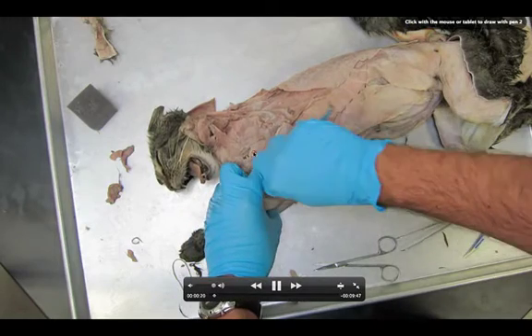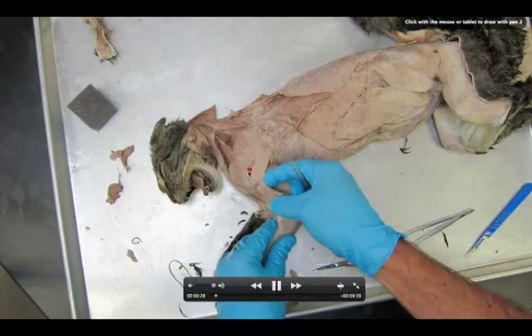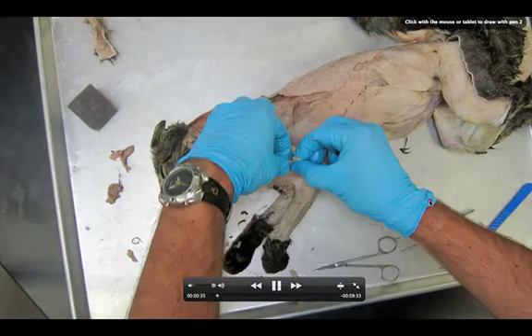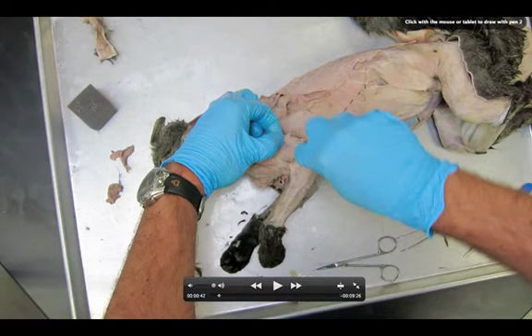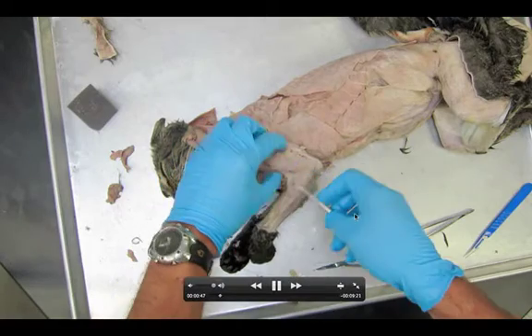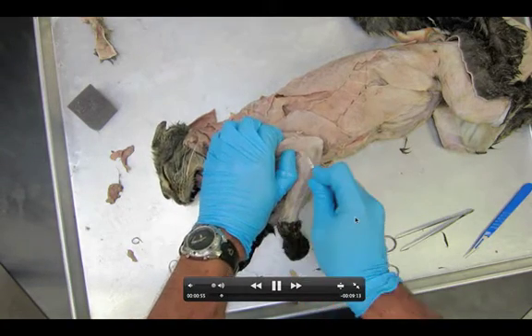It's going to be a lot of connective tissue. In fact, if you got that connective tissue off for the spinodeltoid, that same layer is going to come down as you got that spinodeltoid and acromiodeltoid. Continually pull off that white stuff to get yourself underneath the triceps brachii lateral head. I want you to be careful right here — there is a muscle attached up here that runs down. That's the brachioradialis that you all located when you were pulling the skin off. Do not cut that muscle. Be really careful. Eventually you're going to get your probe underneath the triceps brachii lateral head.